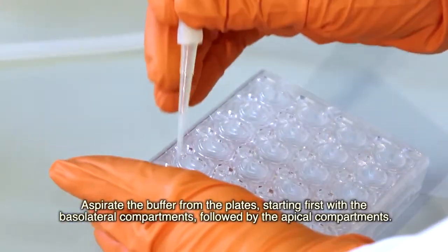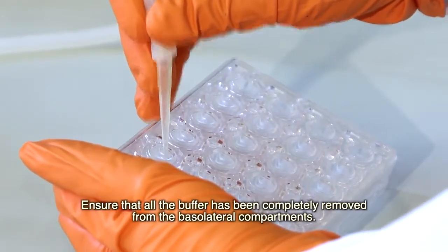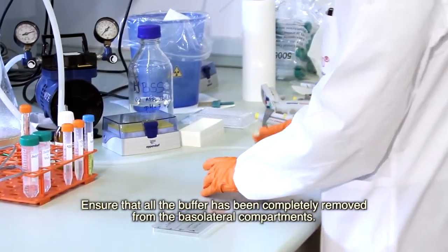Aspirate the buffer from the plates, starting first with the basolateral compartments, followed by the apical compartments. Ensure that all the buffer has been completely removed from the basolateral compartments.